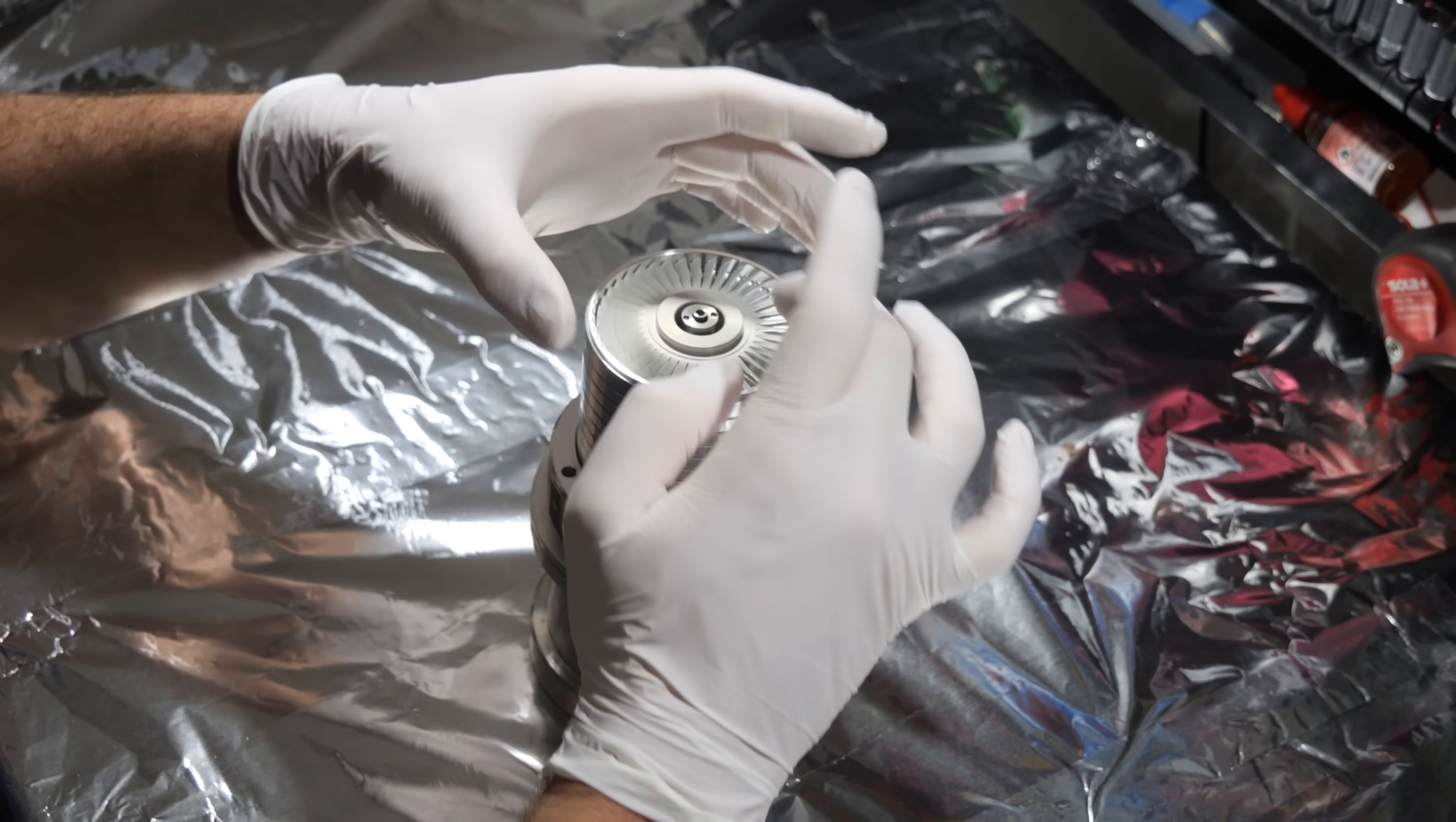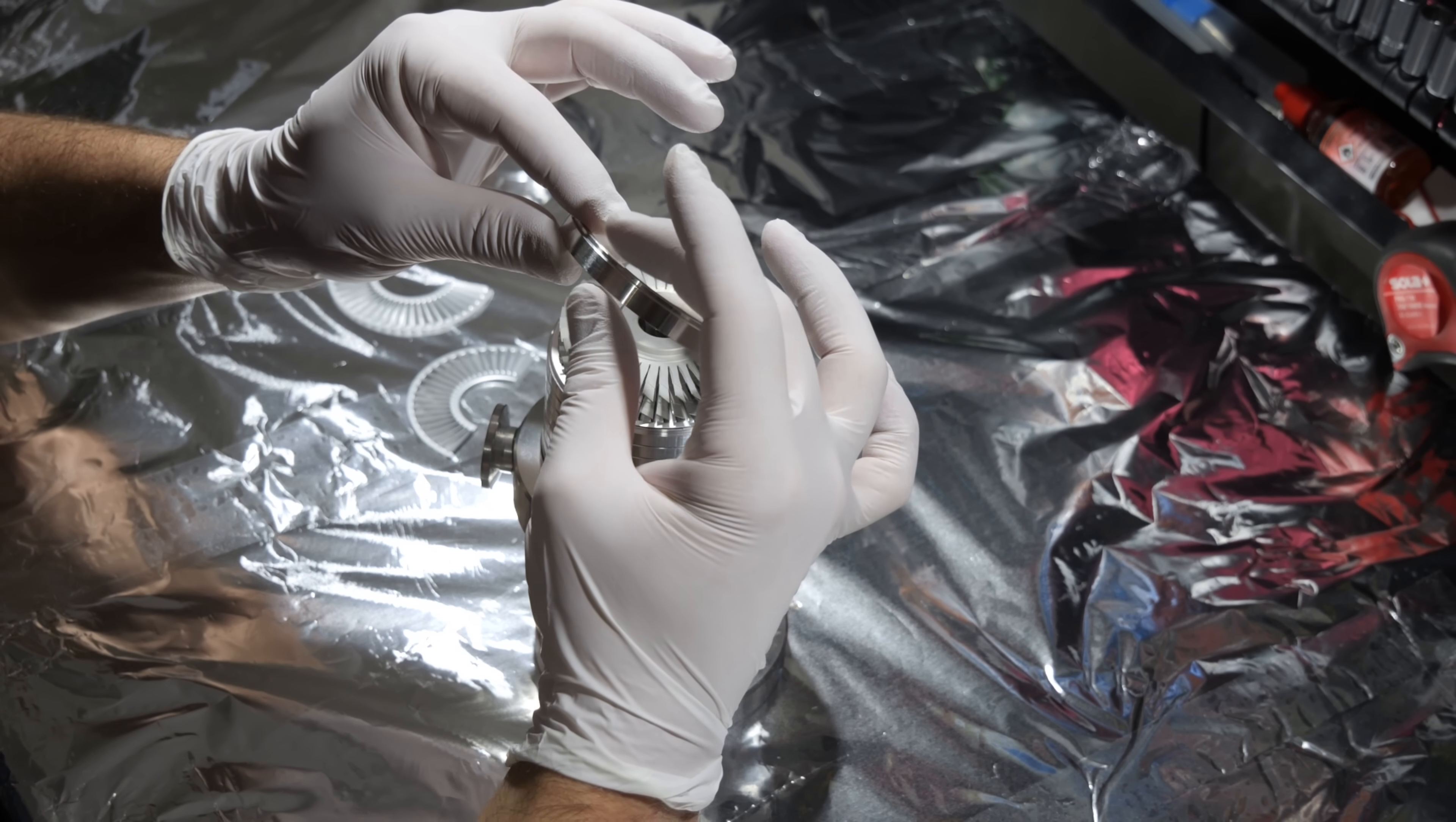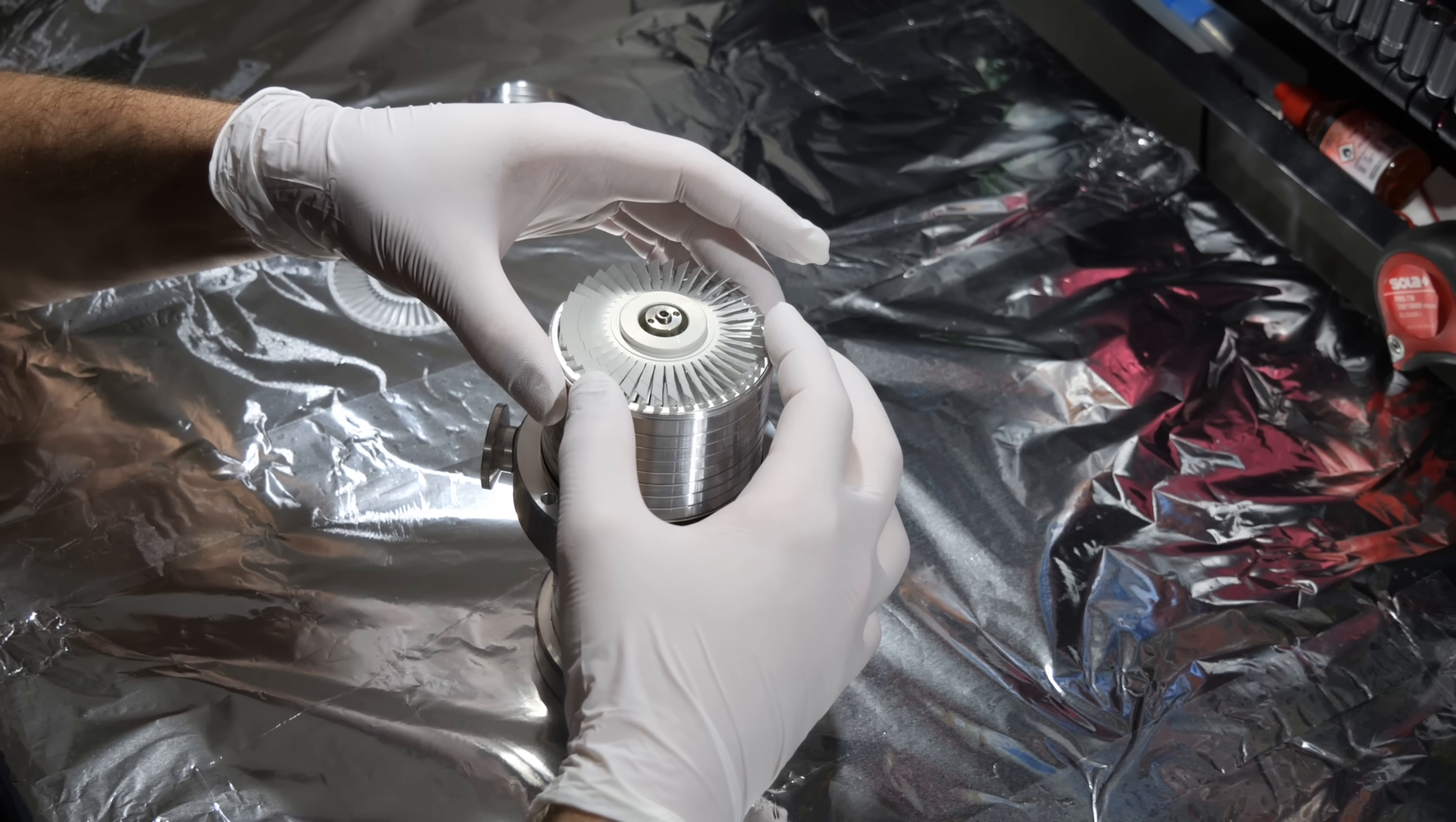For some reason the rotor was binding. Not quite sure why. Okay, I know why it was binding. I just reviewed some of the footage from this disassembly. This ring right here with the larger width is not the top one but the second one from the top. And that explains why it was binding at these stators right here. So now if I assemble everything it should work.